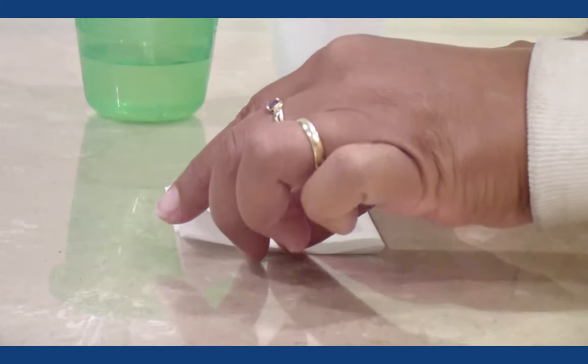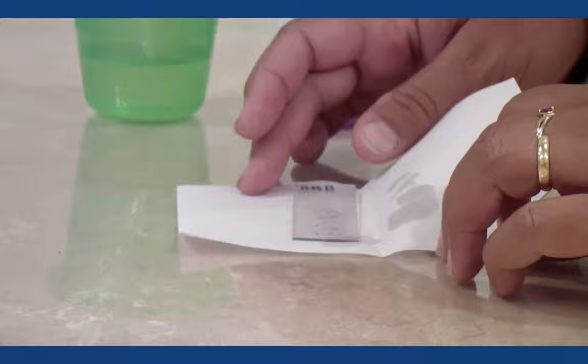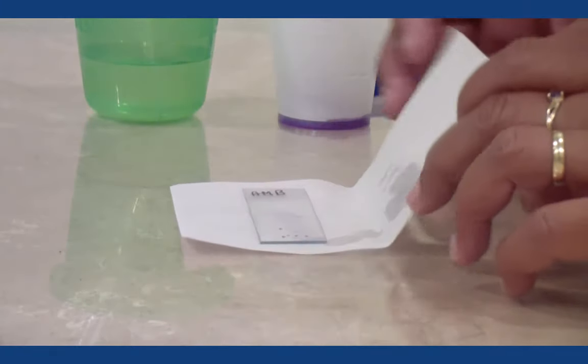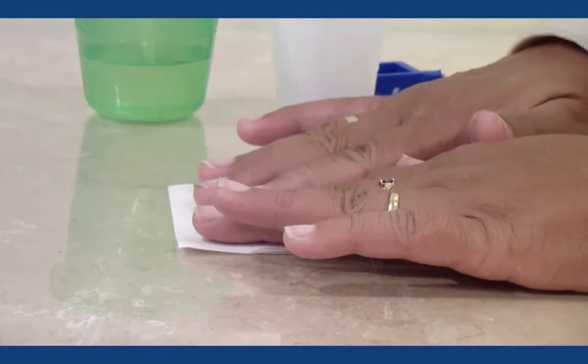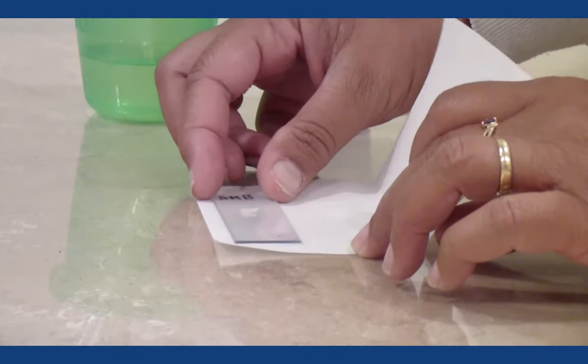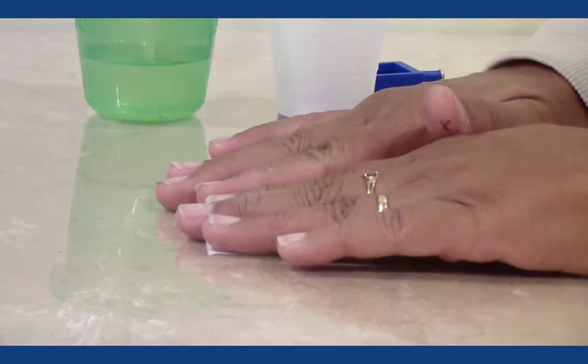Place the slide in between and fold it close. Gently pat the slide. Move the slide over to a dry area of the paper and pat it again. Do not throw out the bibulous paper. Allow it to air dry for reuse later in the semester.